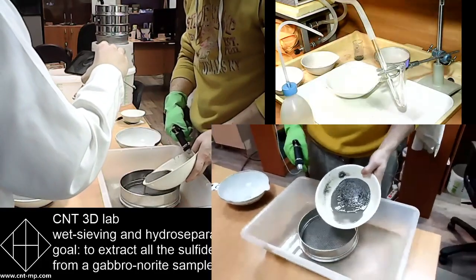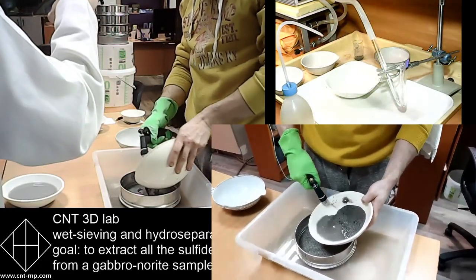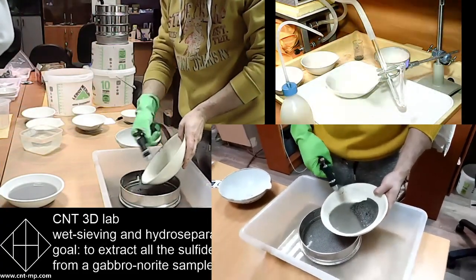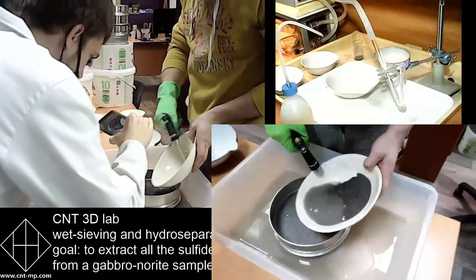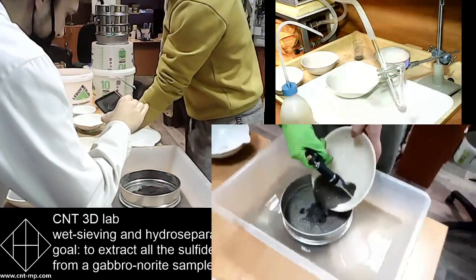And Alec is washing down the sieve the amount of material after Spark 10. Okay, so Alec is washing down to the sieve. What is the sieve size, Alec, that you are using?